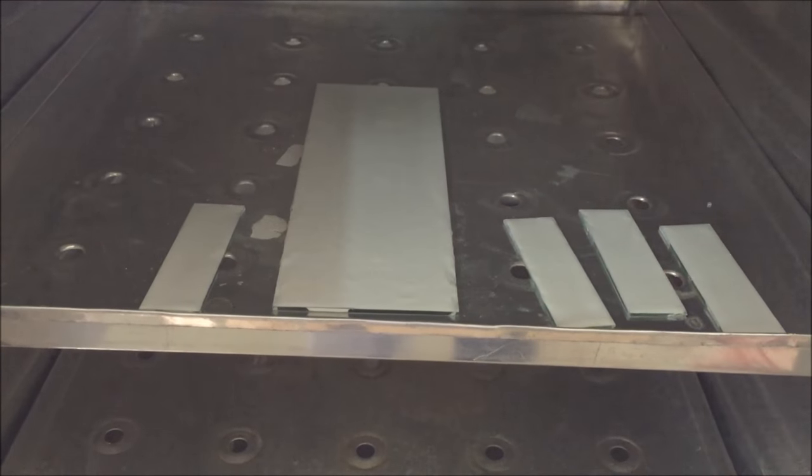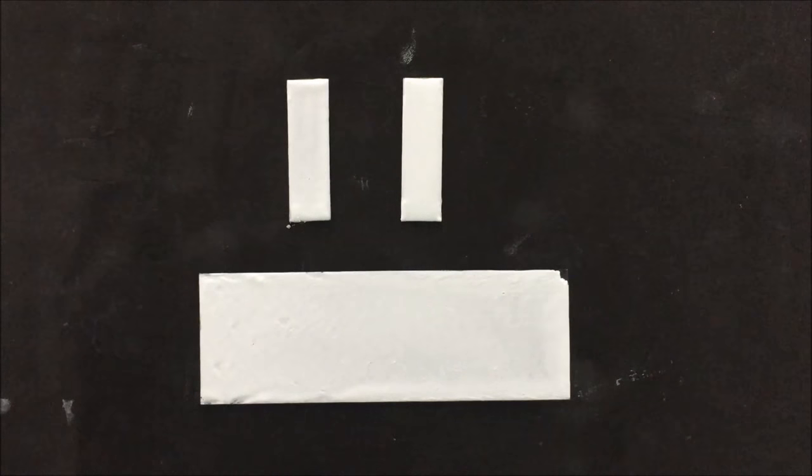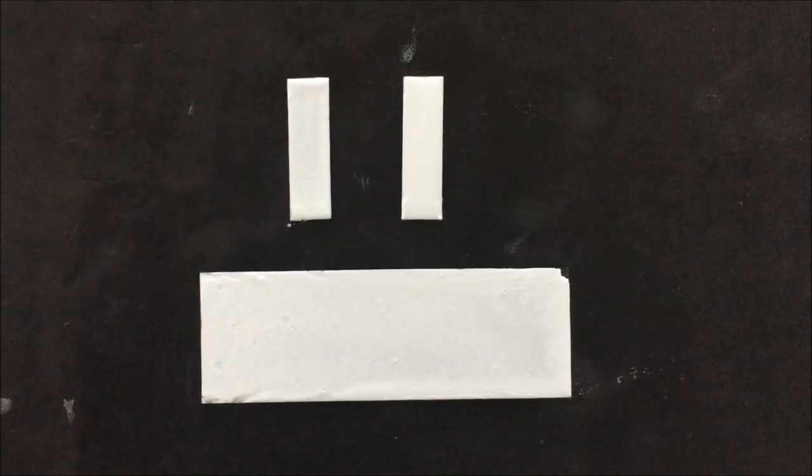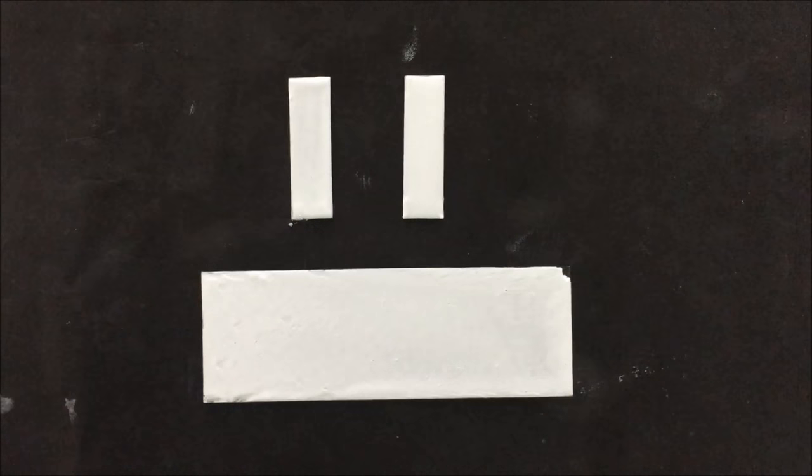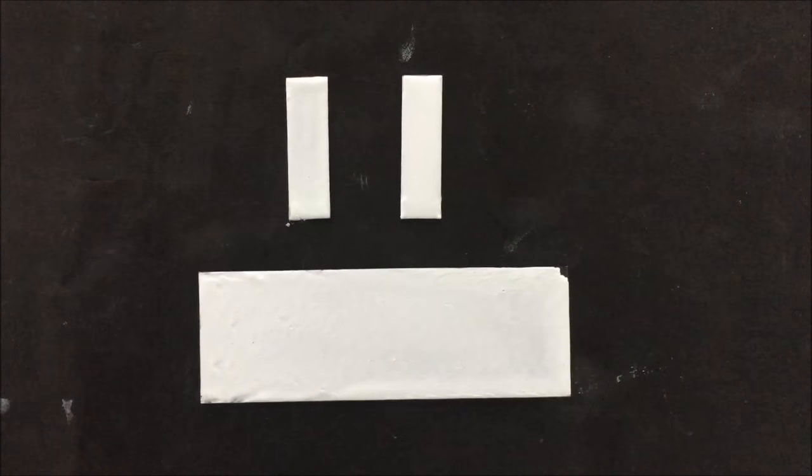After 1 hour, remove the plate from the oven. Now our TLC plates are ready for analytical study. It is very important to note that always use forceps to handle the TLC plates. Do not touch the silica layer of the TLC plates as it can damage the layer and also cause contamination.